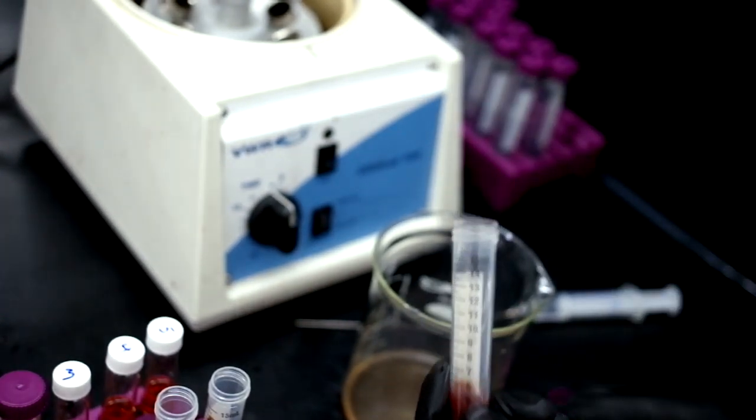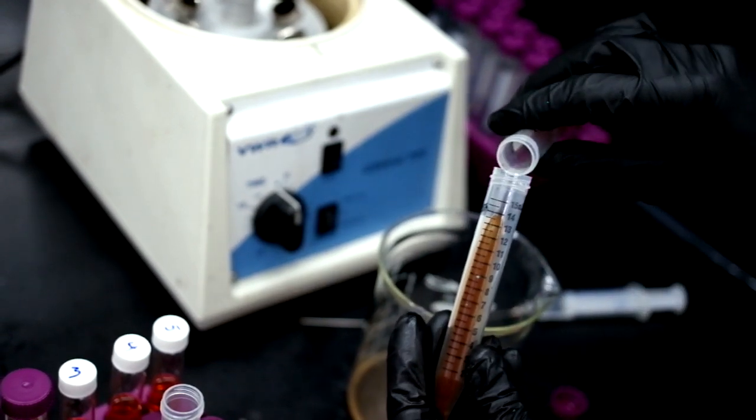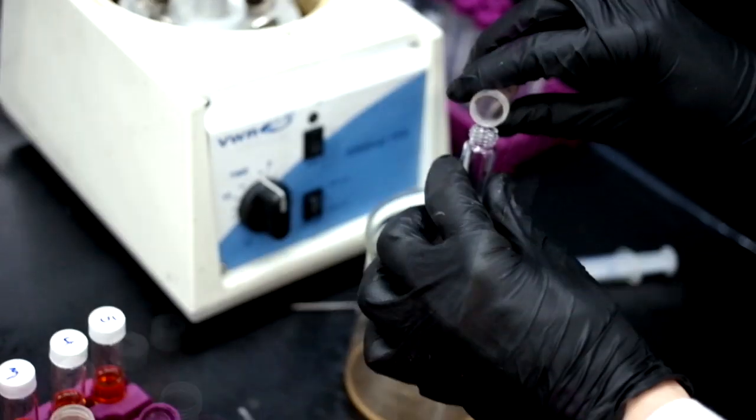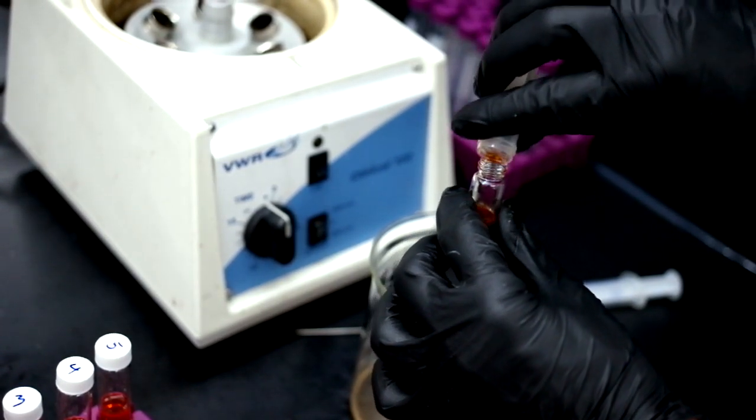Use the same solution to dissolve the crystals in all three test tubes. Once all the crystals are dissolved, pour the final solution into a glass vial.